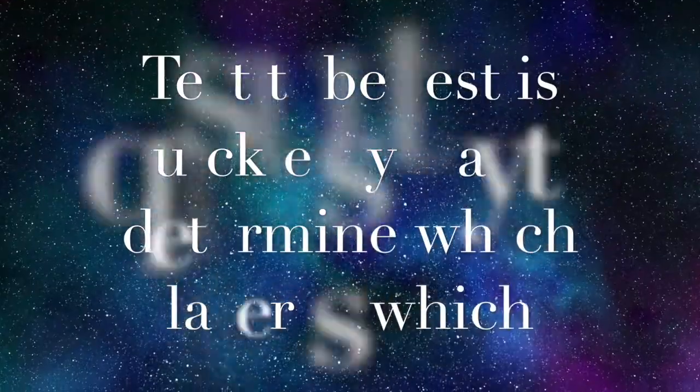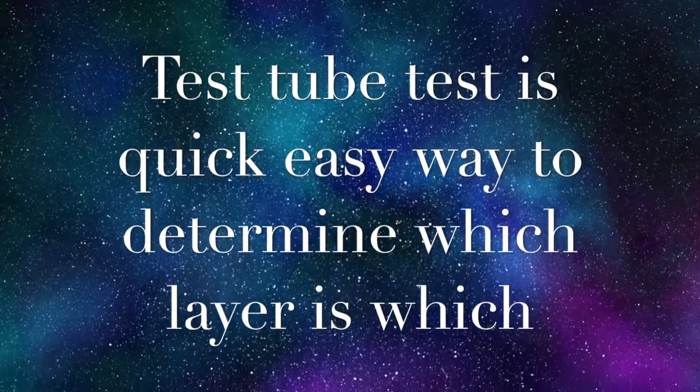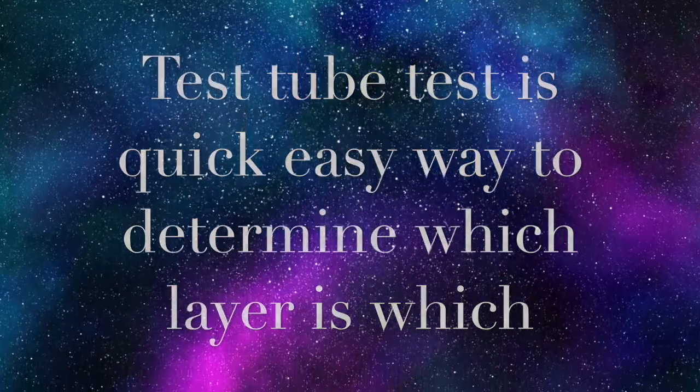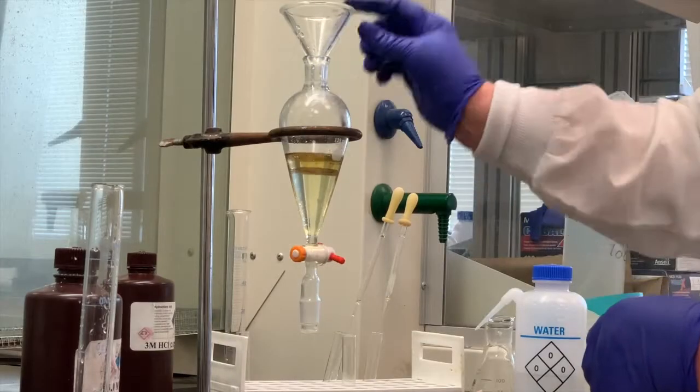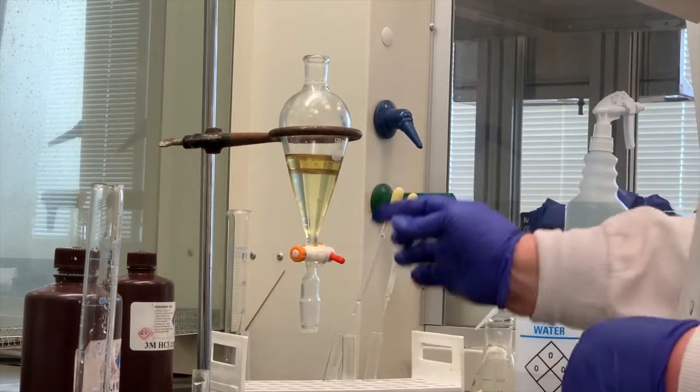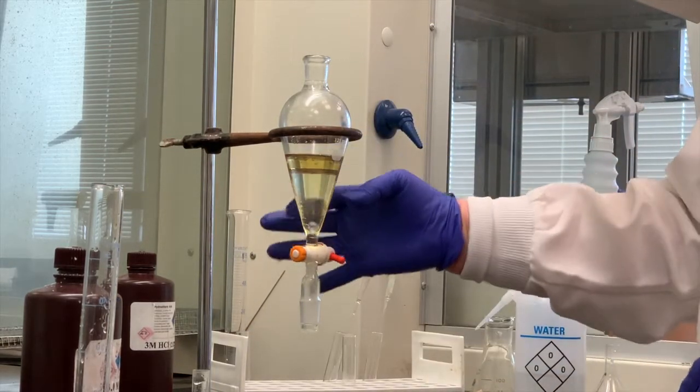And again, if you ever have any question about which layer is which, it only takes a second to do that and you're not wasting anything. All right, so what I want to do is to separate the layers. Now we know that the top layer is the aqueous and the bottom is still the organic.